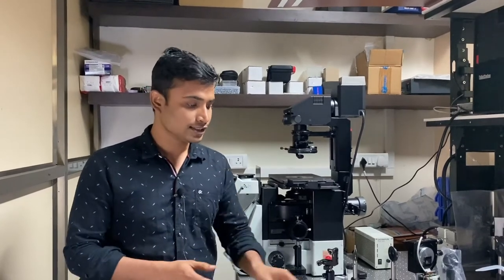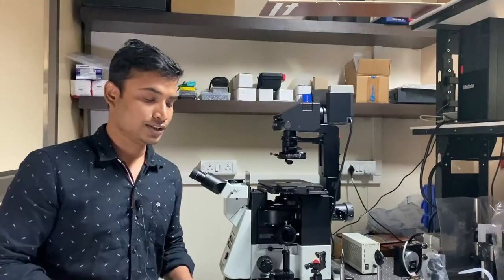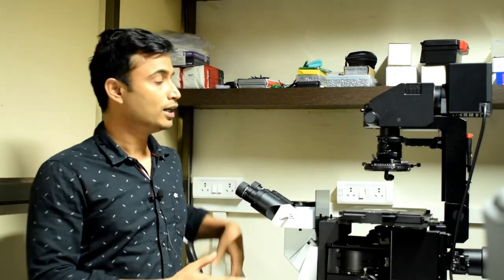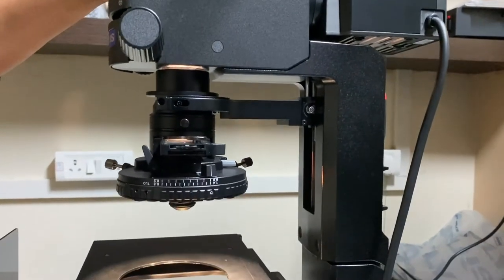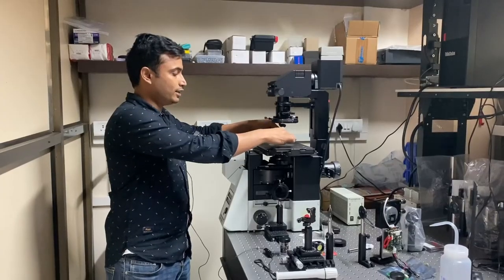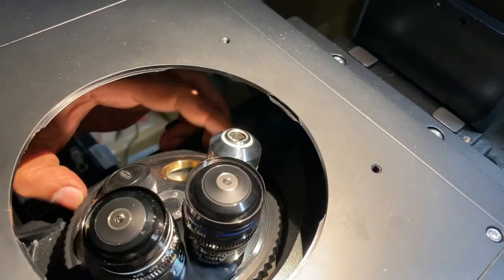Similarly, in a microscope there is a device called the objective lens. There are several objective lenses with different magnifications, and they help magnify the specimen and provide a higher resolution image. Other important parts include the halogen lamp, which provides illumination light to the sample plane, and the sample stage where we place the specimen.